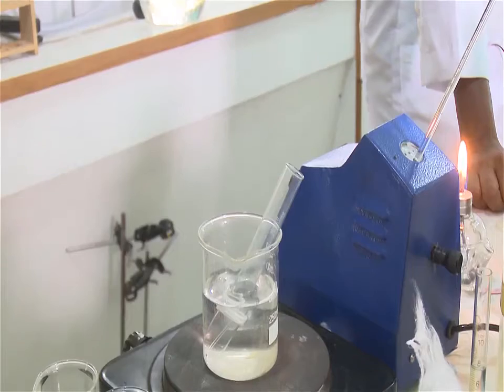The melting point of a solid is defined as the temperature at which the liquid and the solid phases are in equilibrium. In practice, most melting points are determined as capillary melting points, which can be done quickly with a small amount of sample in a capillary tube.